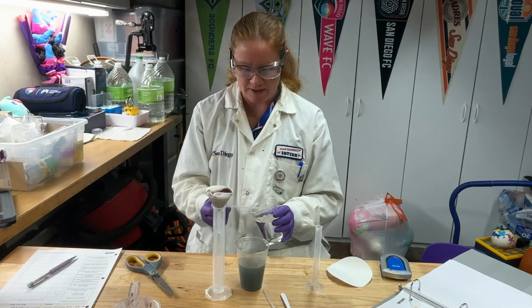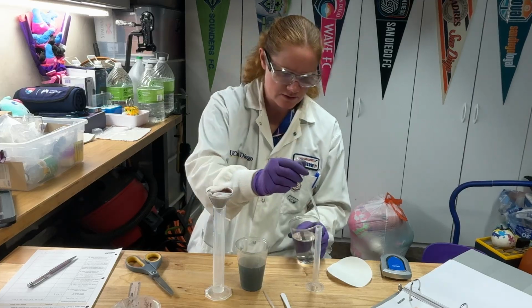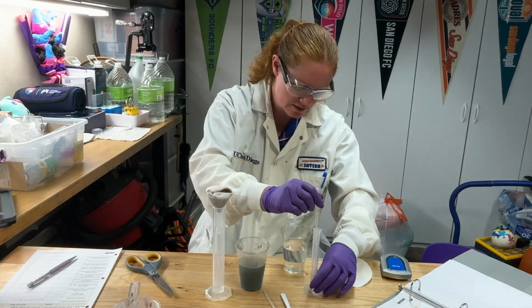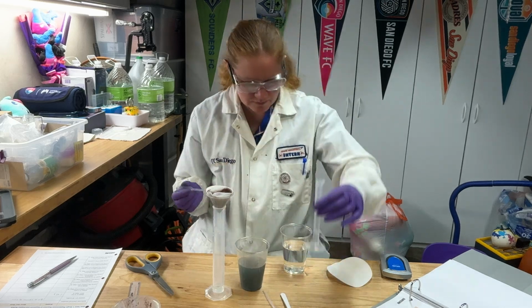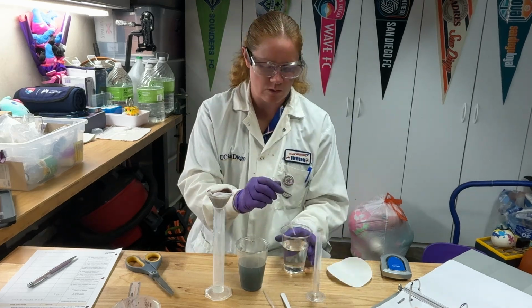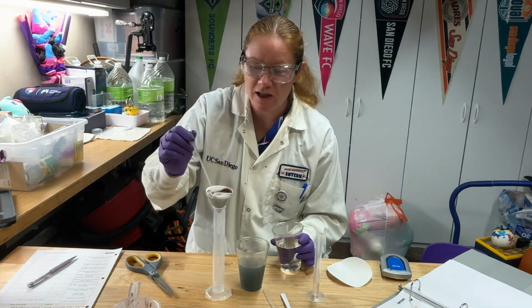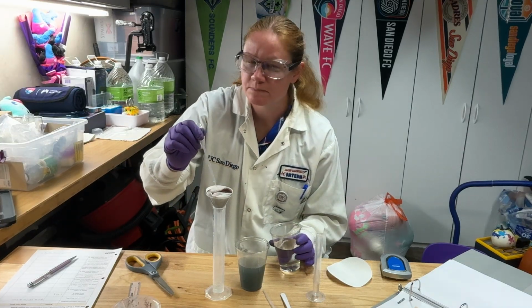These plastic pipettes, let's see here. If I do one squeeze, and then I check, one squeeze was about 2 mils for me. That wasn't filling the whole bulb up. So if I do this about 10 times, that's about my 20 mils.